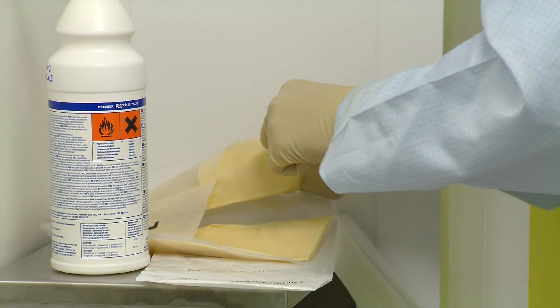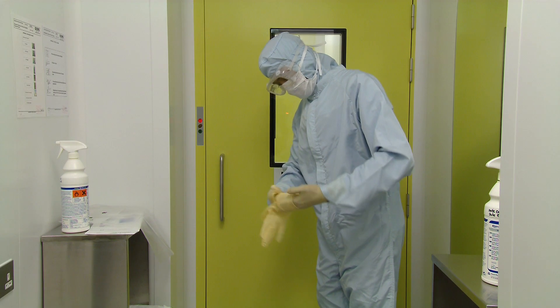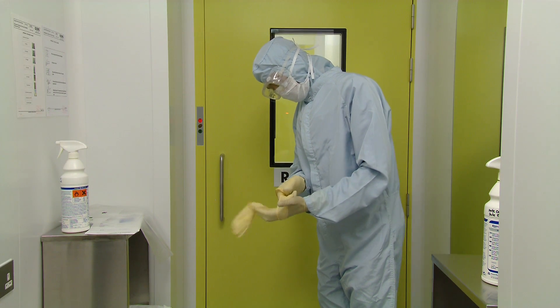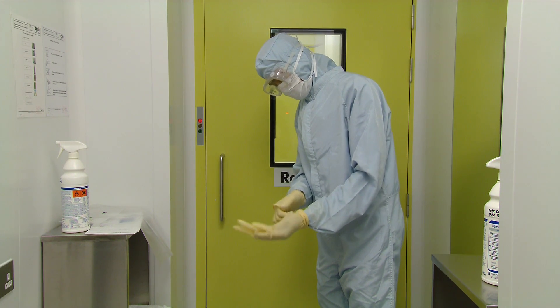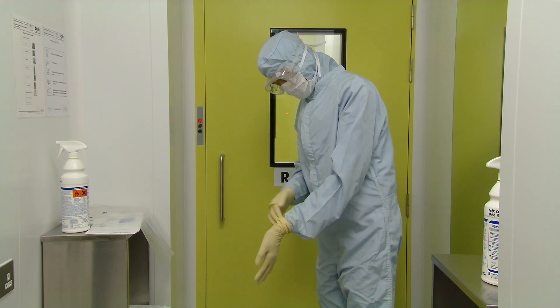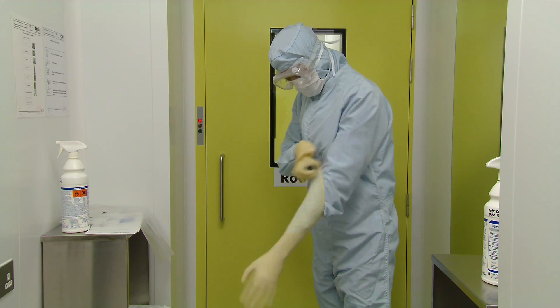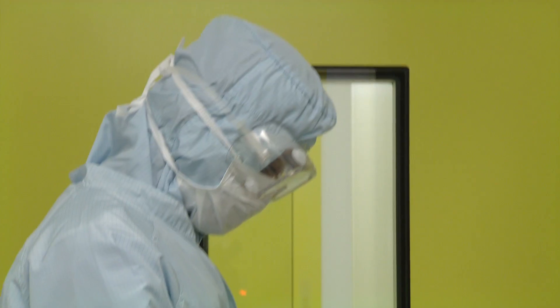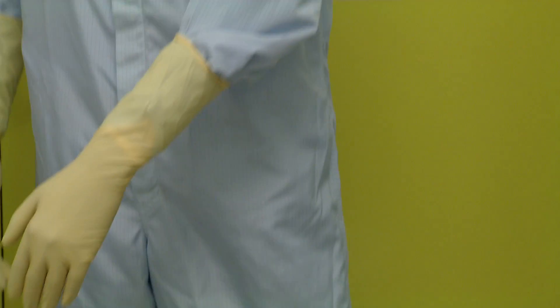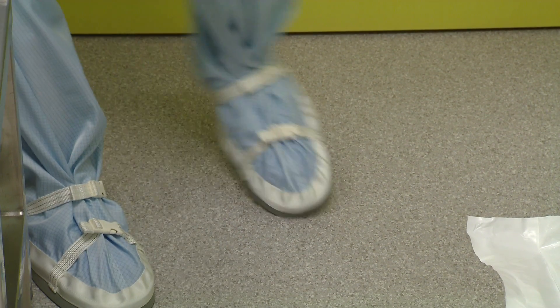In general terms, operators work in clean rooms to fill or manufacture sterile products. By producing the products in these areas, you're protecting the product from contamination — be that viable particulates like bacteria, yeast and moulds, or non-viable particulates like dust or debris. All the steps we take in terms of gowning and working in these graded areas protects that product.